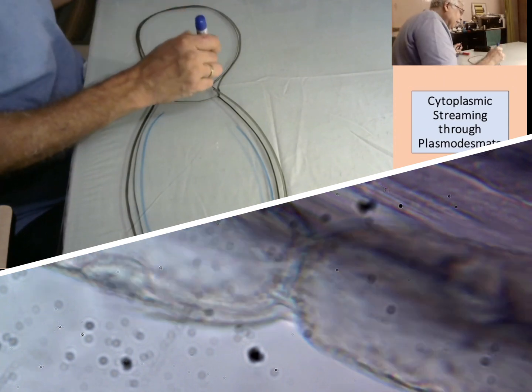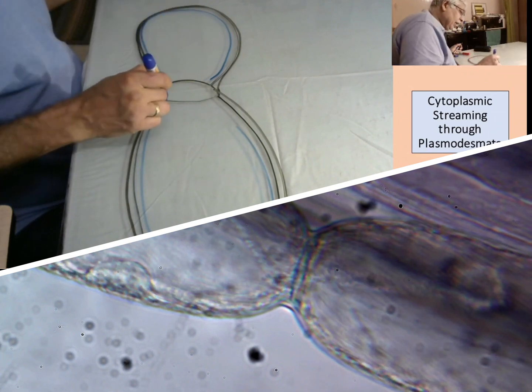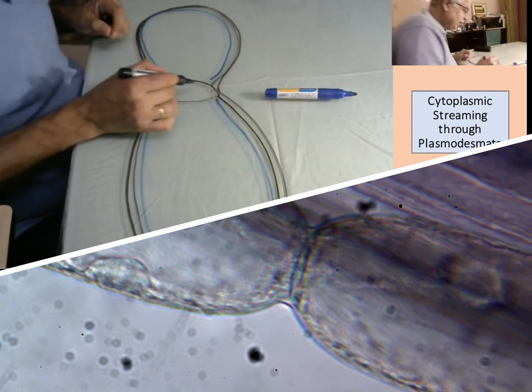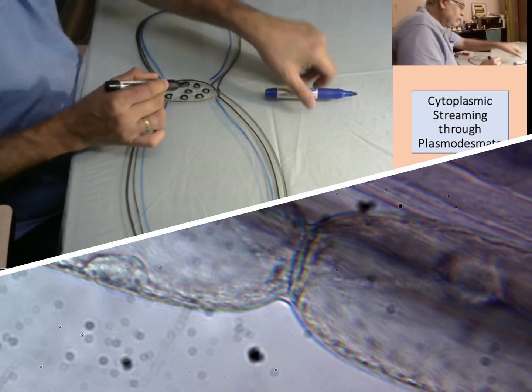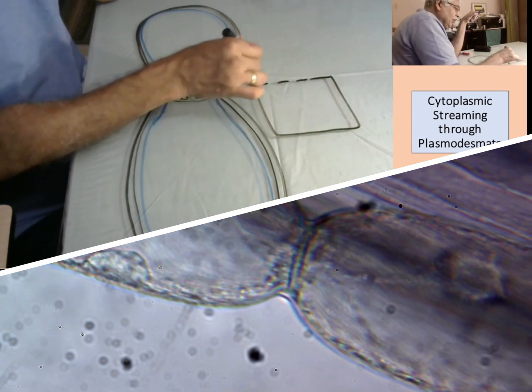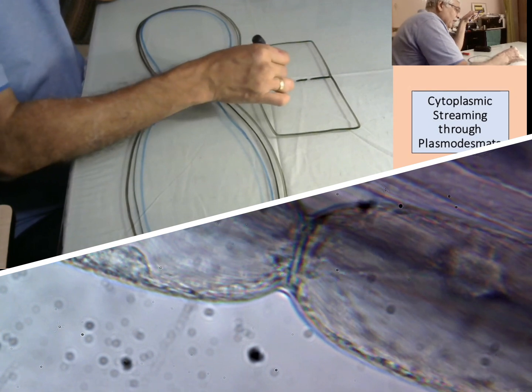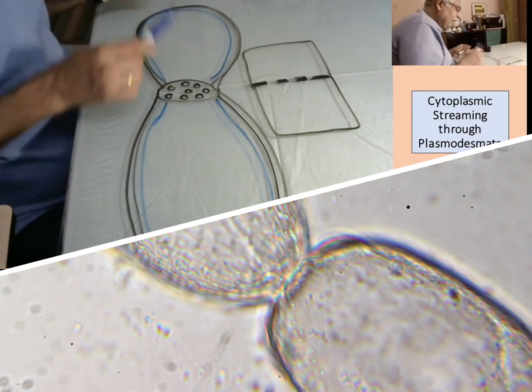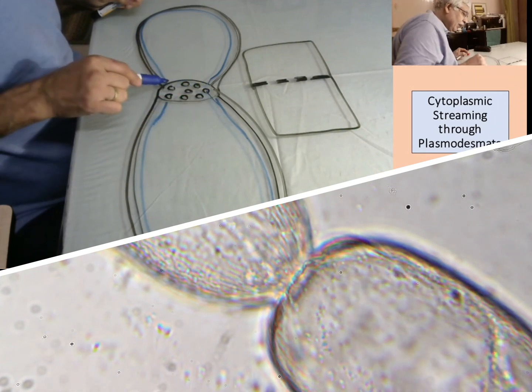The cell membrane we cannot see very clearly, but we can guess that this cell membrane is continuous. In between one cell wall and another there are some gaps. Here we can see where the cell wall is attached. Normally we draw plasmodesmata this way, but here is actually a 3D view where plasmodesmata is connected, and through this even the cell membrane is going.